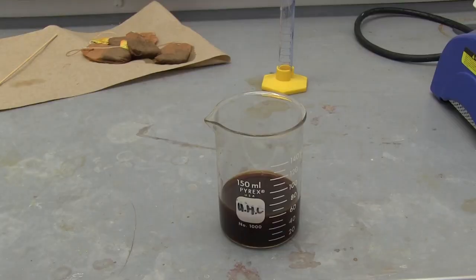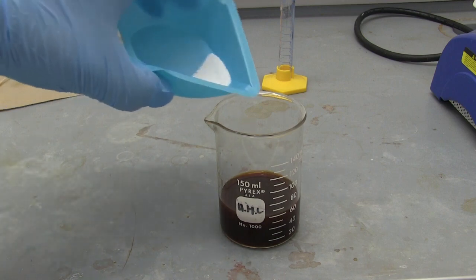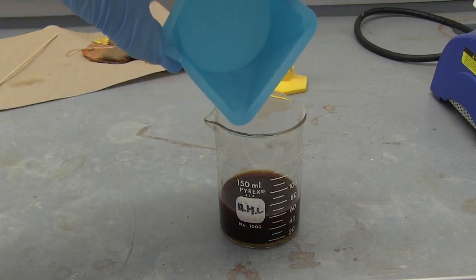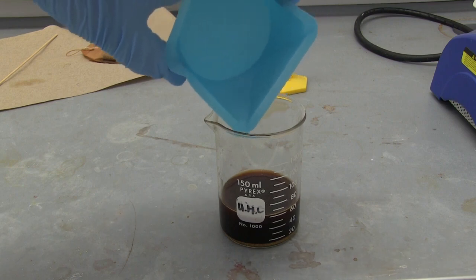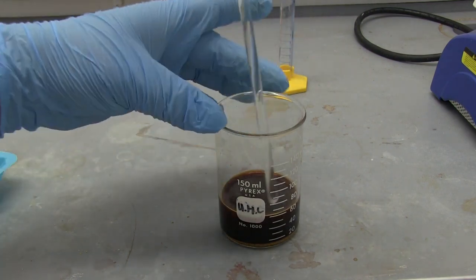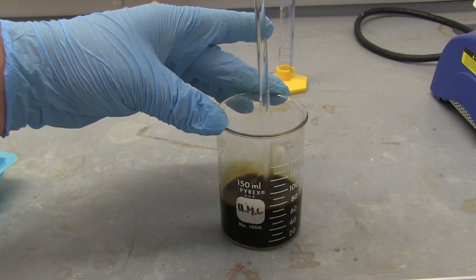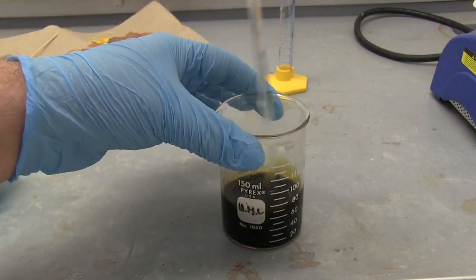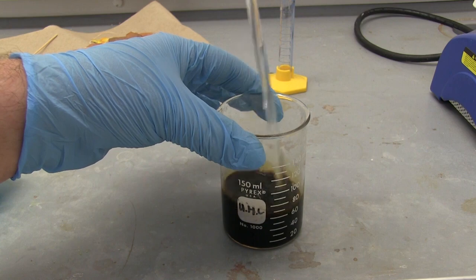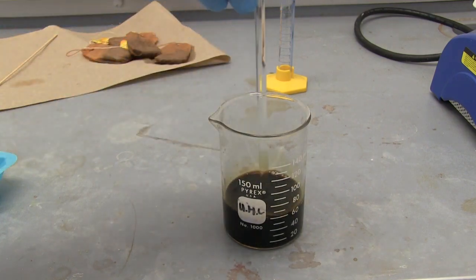Now that our tea has cooled down I'm adding two grams of sodium carbonate. This will react with some of the tannins and other products in the tea and make those water soluble so they don't come over with the caffeine.